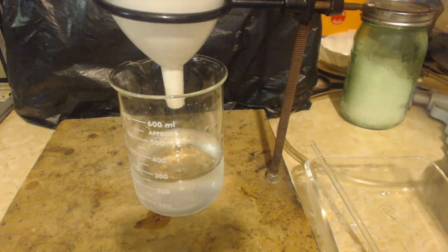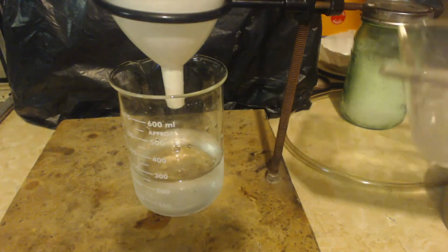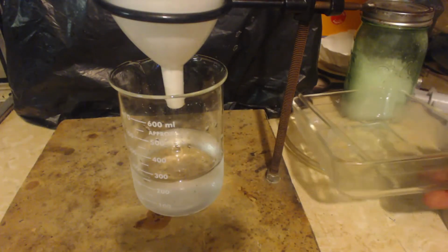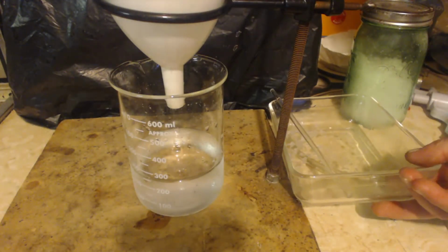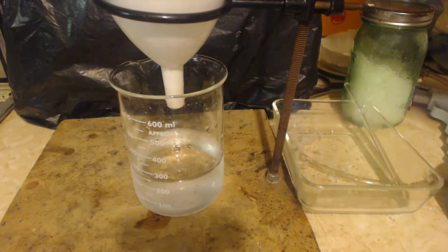Another thing is that I put this pan in the freezer, right? And if it was ammonium chloride, a lot would have precipitated out. And really there was no change in the precip. It was the same amount. And that's what would happen if it was calcium sulfate.